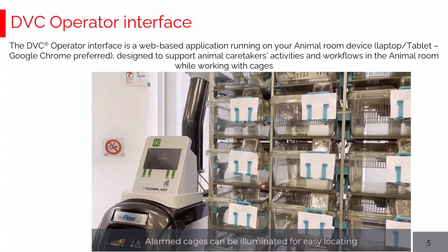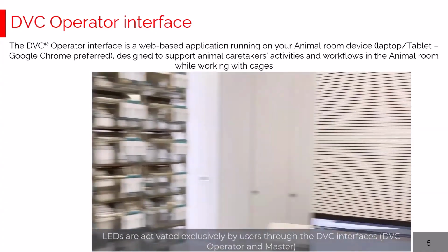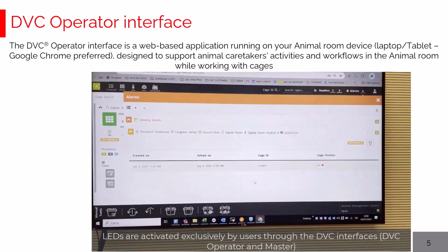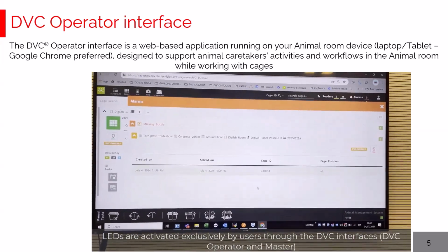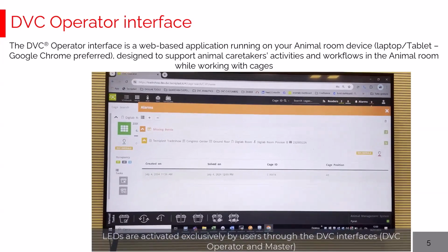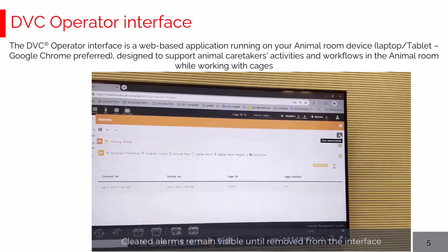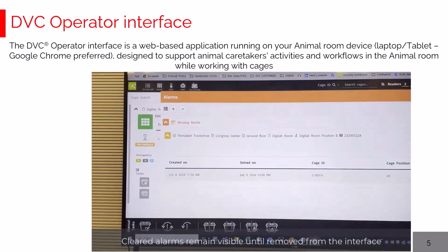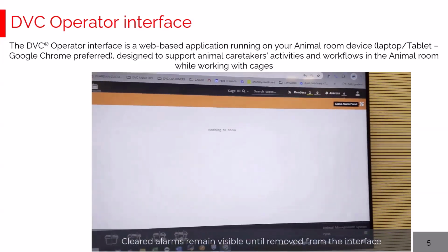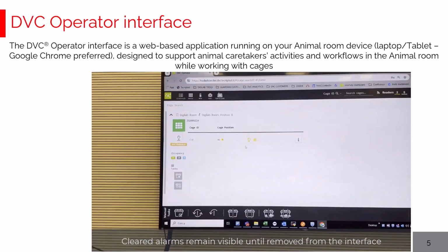LEDs, very important to mention, are always activated by your interaction with the system. The DVC will never activate LEDs automatically. It's always you interacting with the DVC operator interface or with the DVC master. When an alarm is cleared, because in this case, for instance, the water bottle has been inserted, you can also see when it is solved. If you click the bin, the cleared alarms are removed.